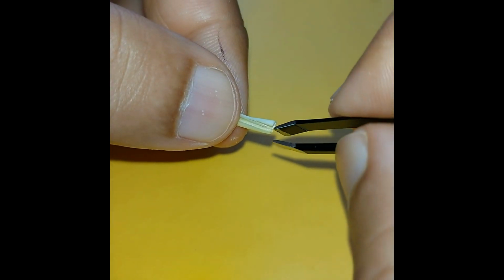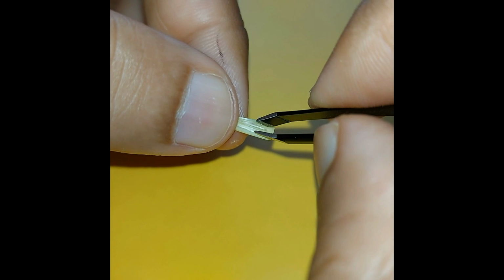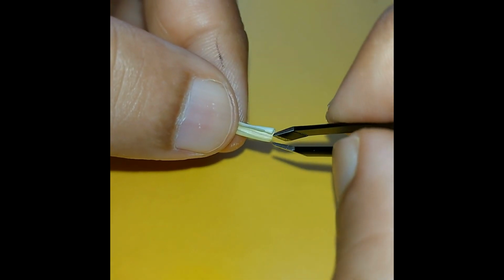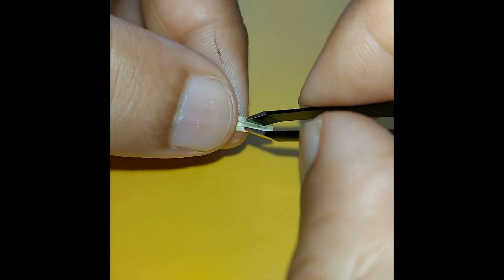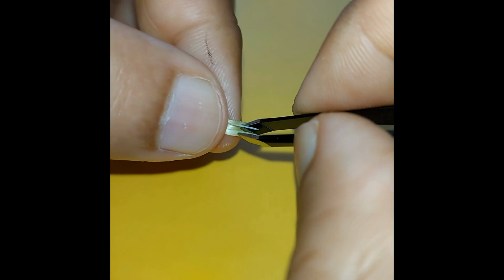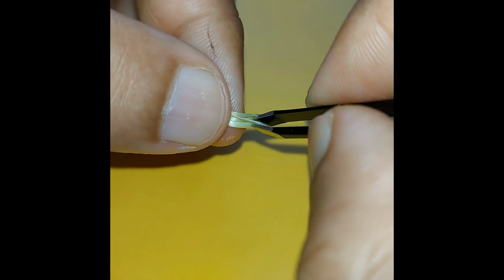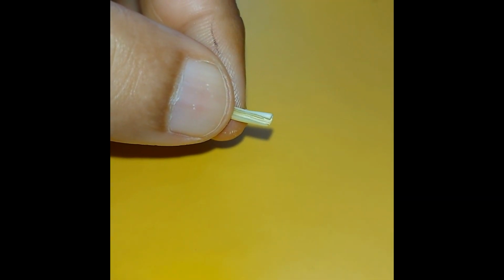Okay, I've made an incision, and you can see these tiny straw-like structures inside. You can see here one. This is actually the style. Okay, this is actually a style, and the pollen is so small it will travel throughout the whole length of this tiny little style, reaching towards the ovaries and also the ovule.